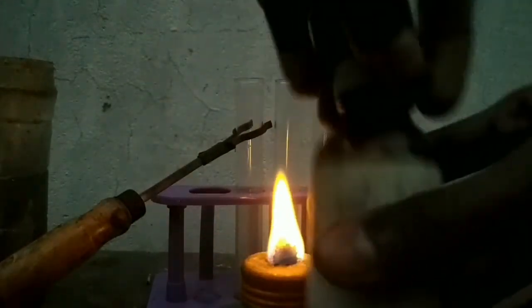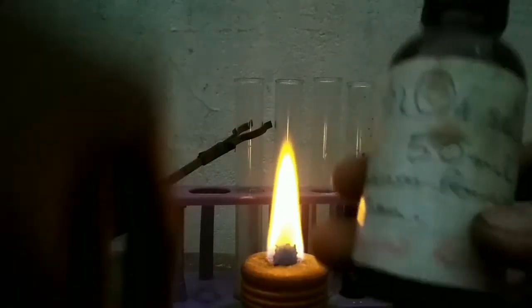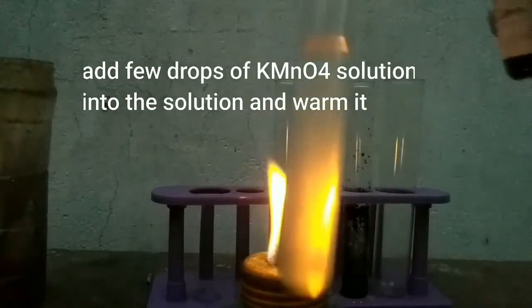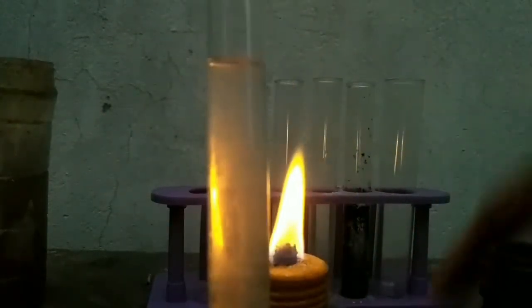The precipitate dissolves. Now into this solution, add potassium permanganate solution.